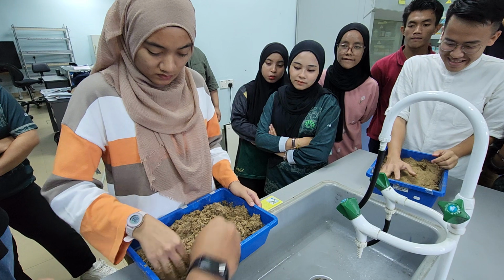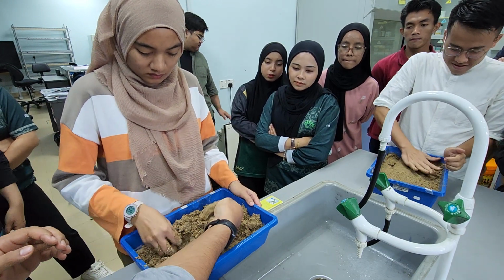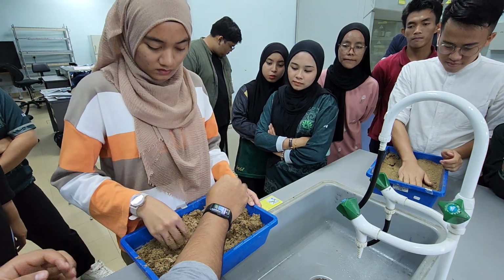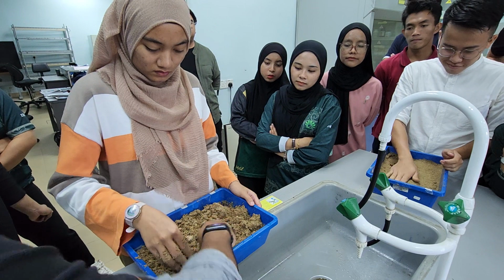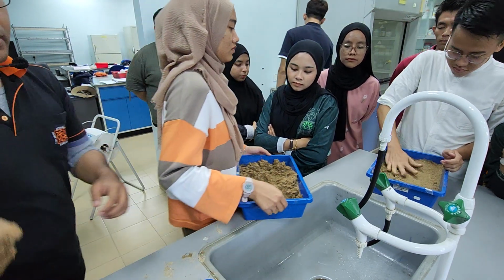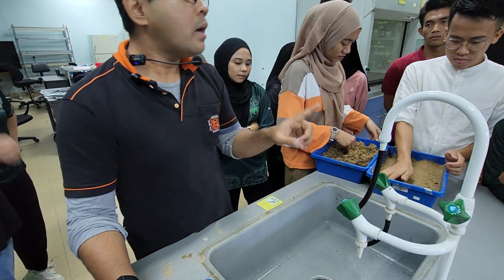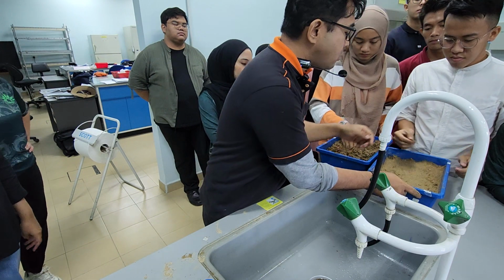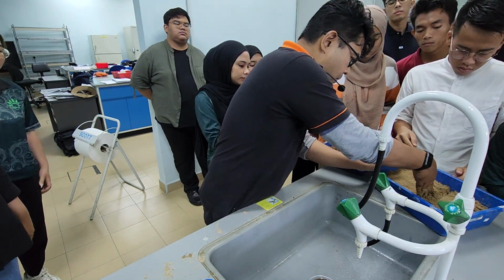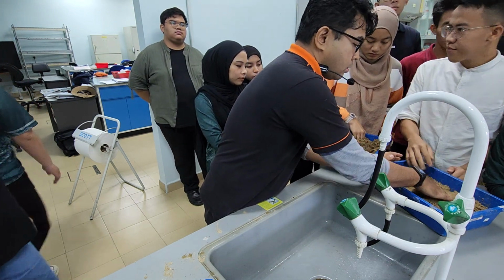Okay, so you can see that after the consistency has been achieved, you can form a ball like this and the color is getting darker. Okay, right. So let's say that's done. Let's see how do you do the germination. So you are going to do the biomass harvesting for 2 weeks. So it's a good idea now to do this into 2. Maybe you use a paper or something. Can somebody get me a graph paper? The paper.